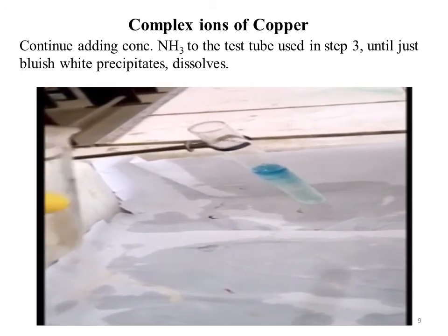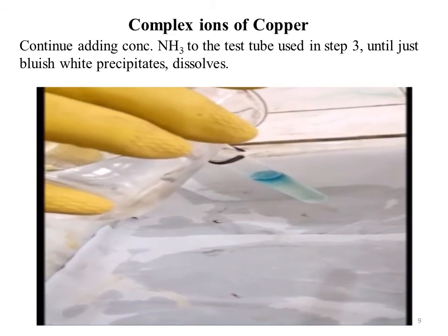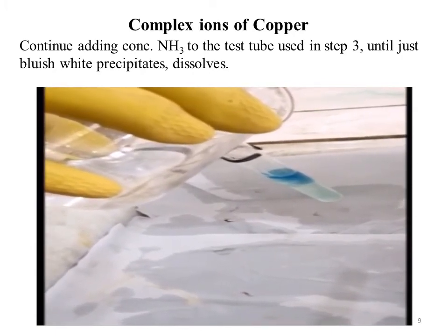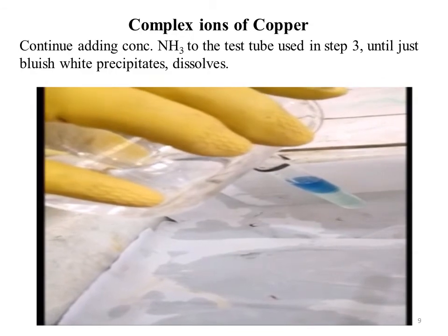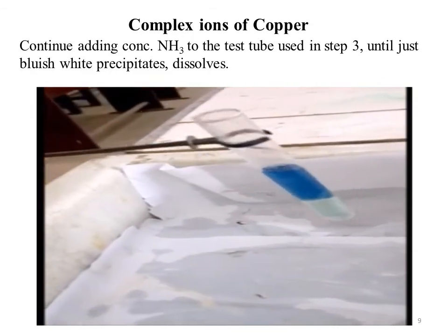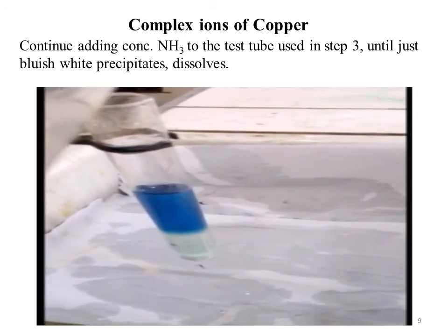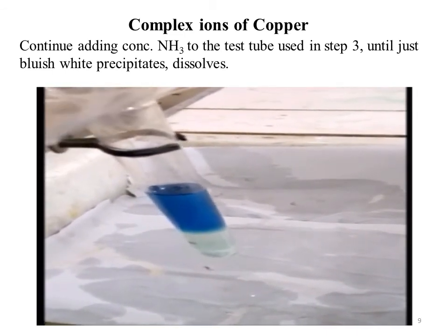So watch this video. The bluish white precipitate appeared first and then in excess, you can see this bluish white precipitate dissolve, giving the royal blue solution.